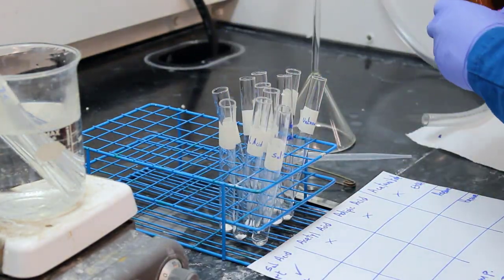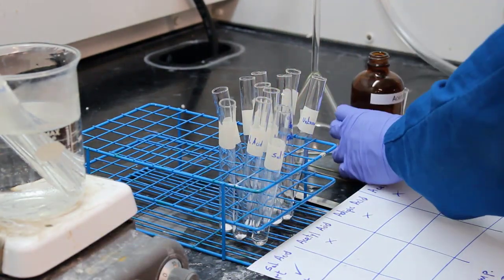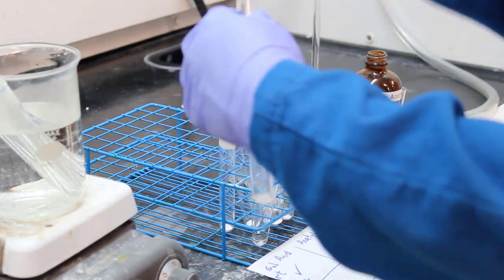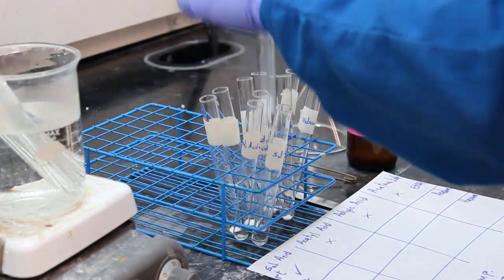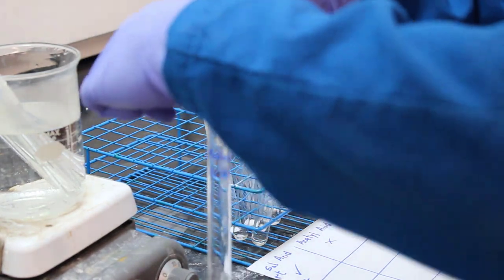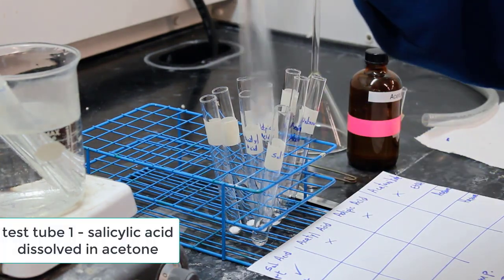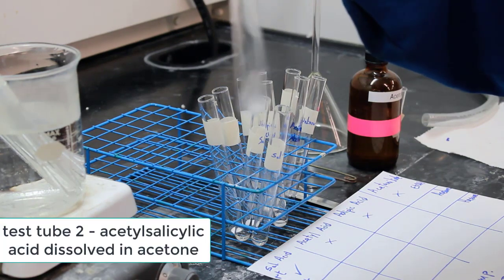All right, next up, let's look at what will dissolve in acetone. So adding 0.5 milliliters of acetone to another set of test tubes. There's our salicylic acid. I can't read what that is, but there's adipic acid, I can see that. I think that's acetanilide. And then, oh, wait, did you add any to the unknown?